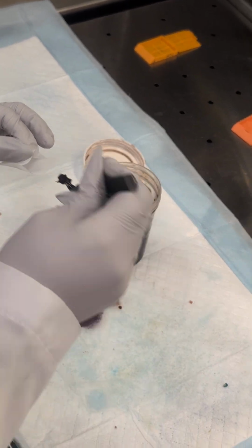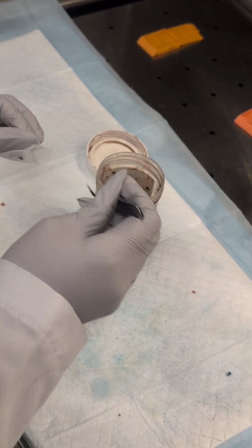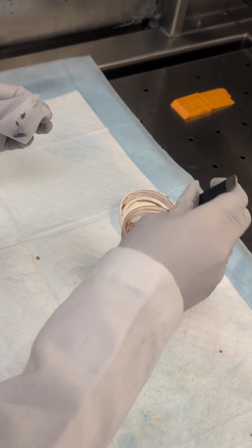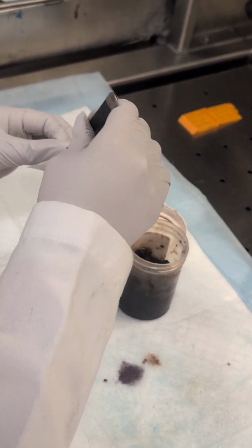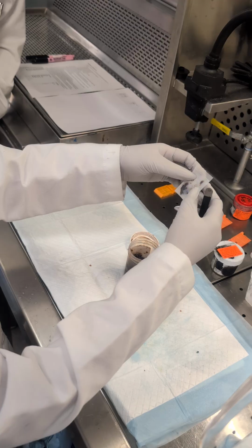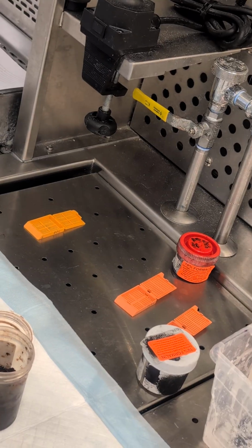Does this phrase aggregate POC mean multiple tissue from the pregnancy? What do you mean multiple tissue? Oh, I was guessing the meaning of this vocabulary. POC is going to stand for product of conception, but an aggregate is tissue that's not all whole, like it's probably going to break apart. So this is how you would do this, and then you would twist, or fold it down like this, and then you'll put it in your cassette just like that, okay?